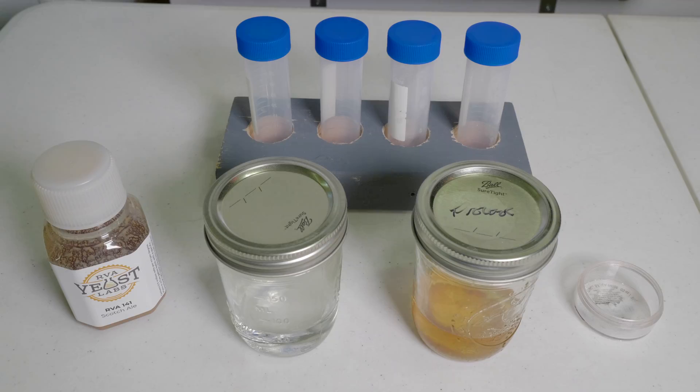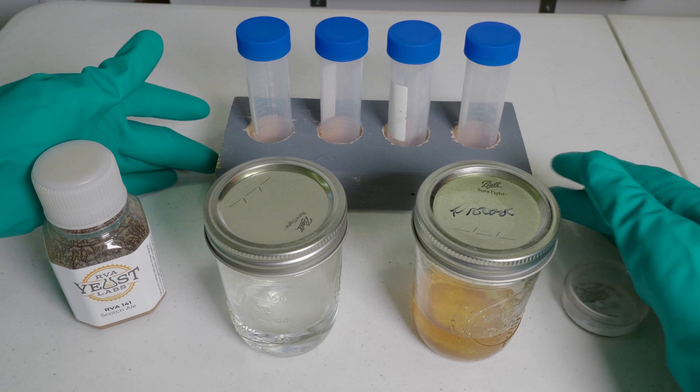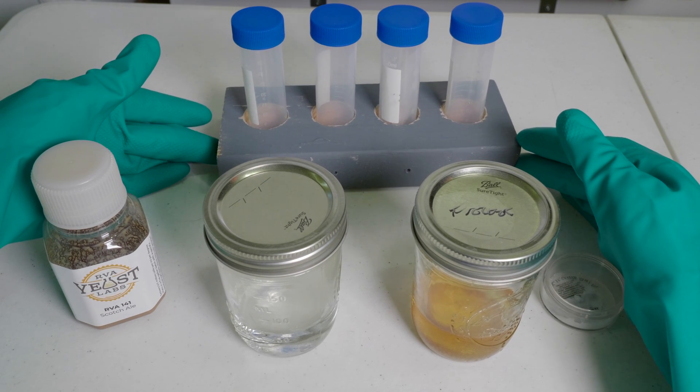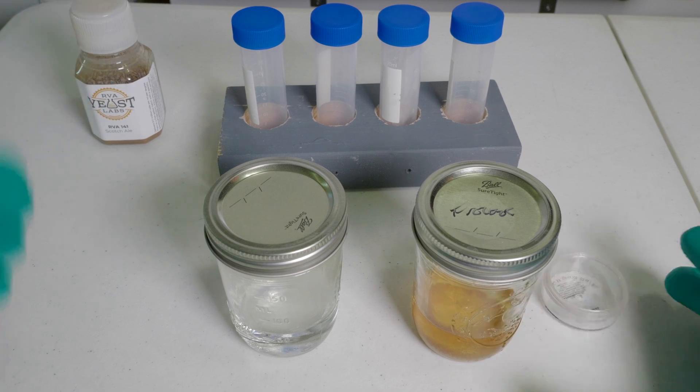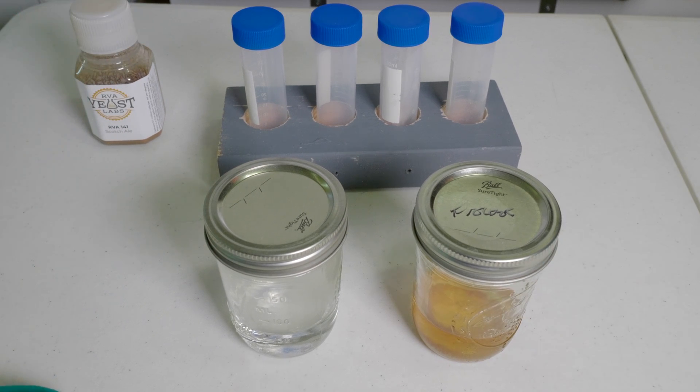Here's everything laid out on the table, which I pre-sanitized. I've got the wort, the glycerin, yeast, ascorbic acid, and the vials. I'll get to the ascorbic acid in a bit.